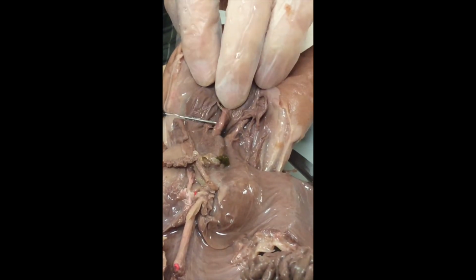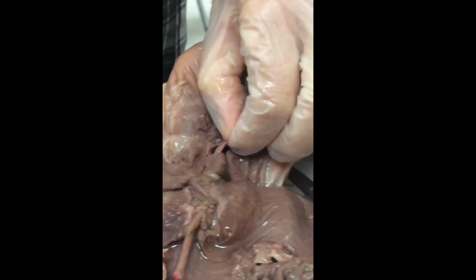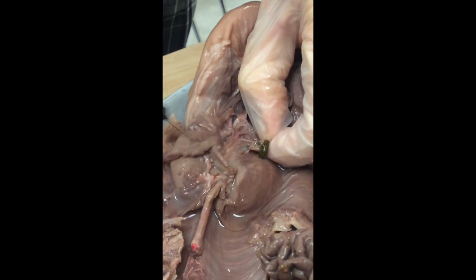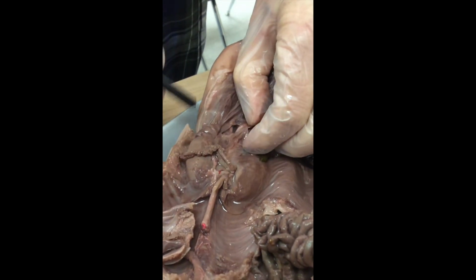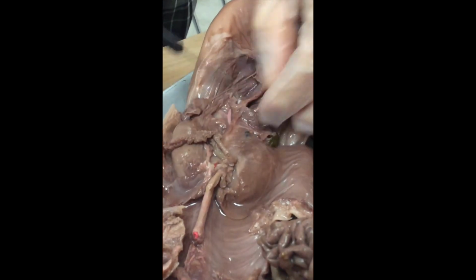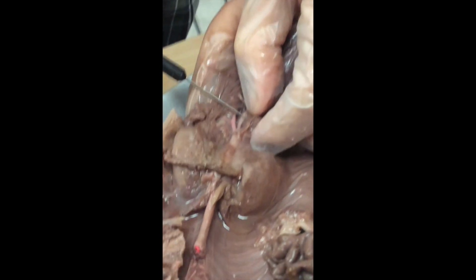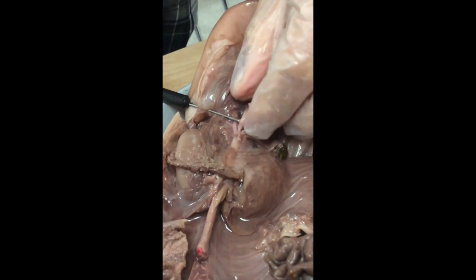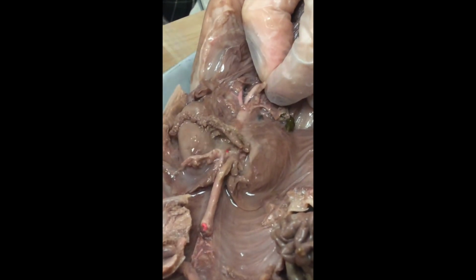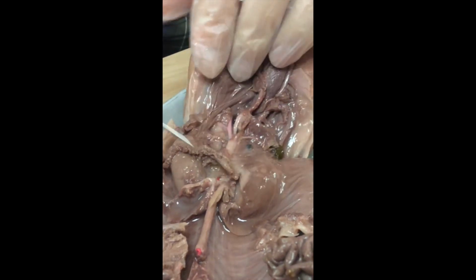There are those two umbilical arteries coming down. They have to attach to the aorta, getting that rectum out of the way. And when I do that, and I'm teasing right here, we can see where the umbilical arteries come in and do merge with the aorta. You see that right there. See that merging? So as the baby pig's heart's pumping blood through the aorta, it's going to travel through the umbilical arteries up to that placenta.